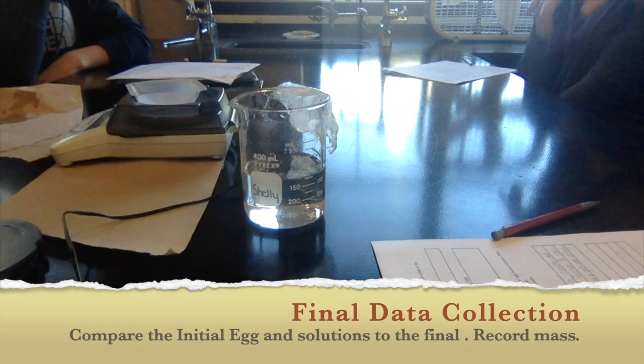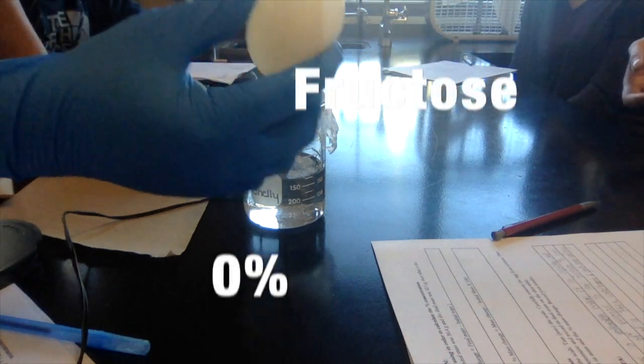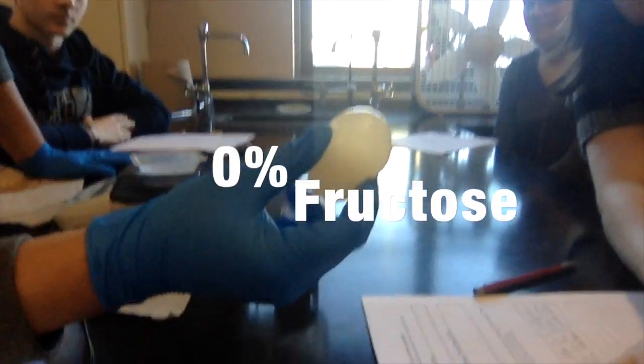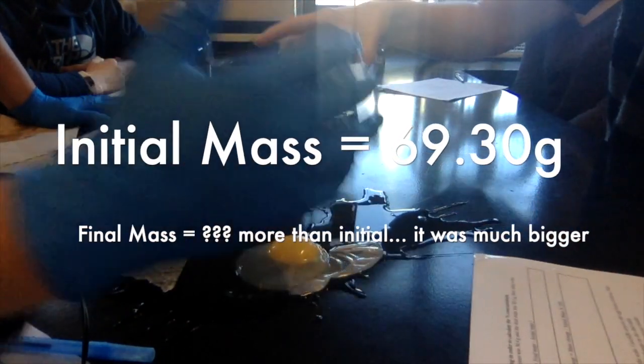So we're recording. Can you just simply describe what you see of the egg into the camera without dropping it? Be careful. Well, I see it's like really squishy. The yolk, you're able to see the yolk just flowing around in there. I dropped it. Oh no. Okay, that's okay.